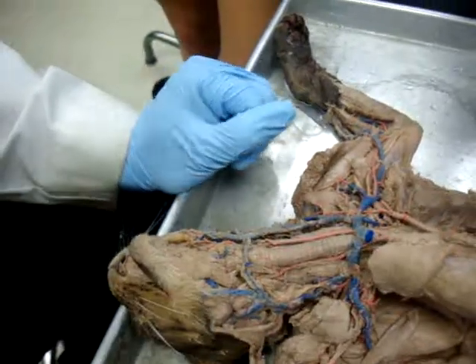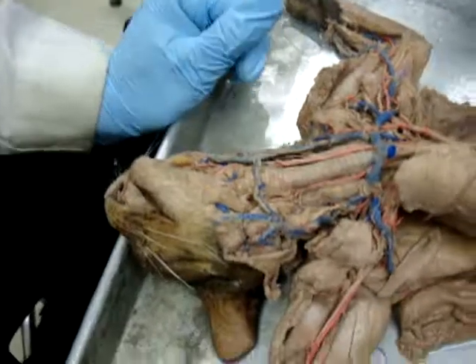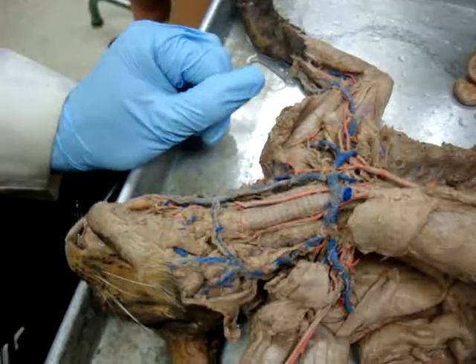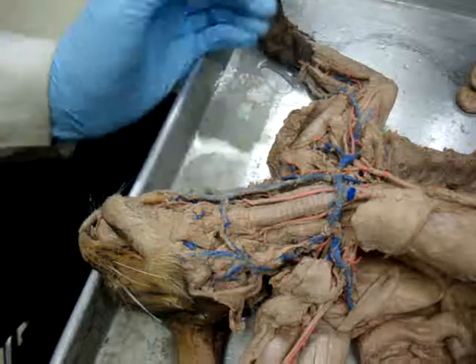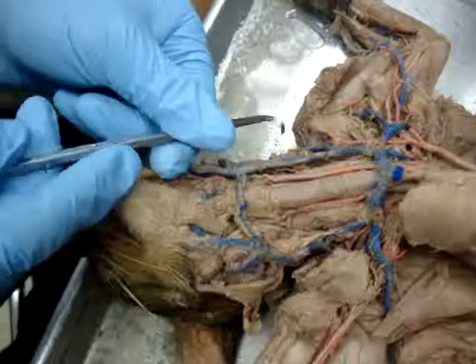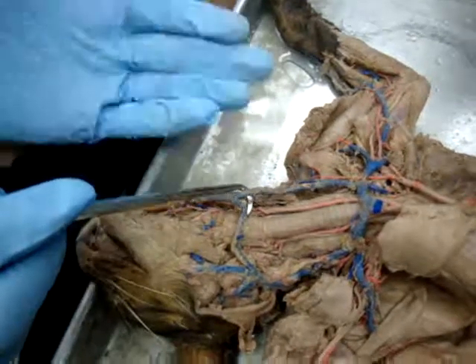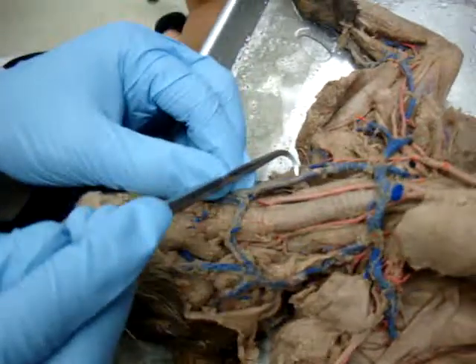Now remember that in the cat, there's actually more muscle on the outside of the head than there is brain on the inside of the head. Cats aren't ever known for being smart. So what we're looking for is a big external carotid and a big external jugular, and small internal carotid, small internal jugular. So if you looked at this and you were thinking in terms of human, I'd expect you to say internal carotid, but it's not. This is a cat, so this is external. External jugular right here.